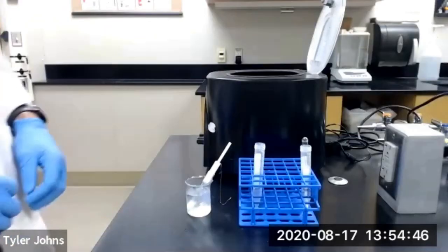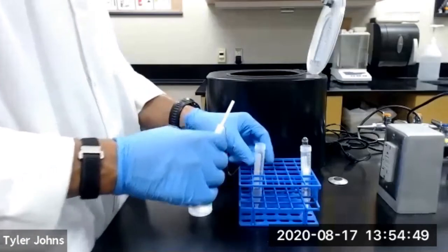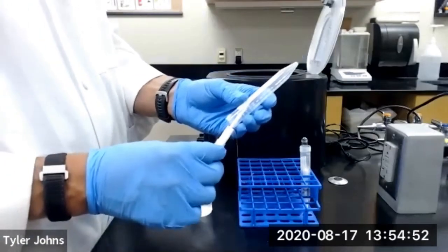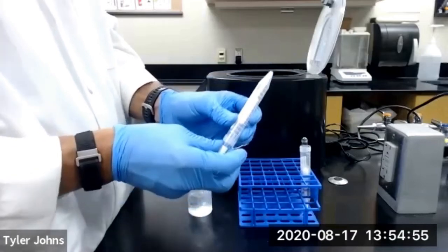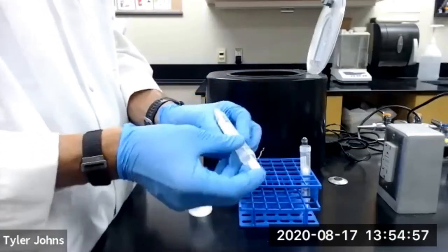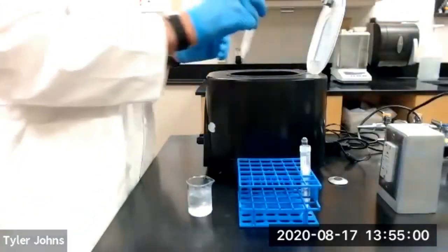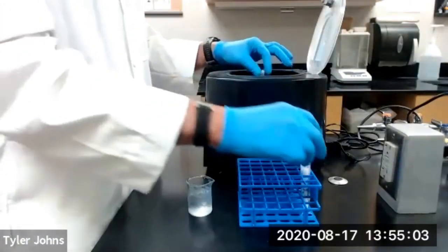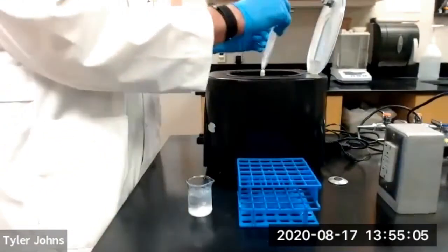Now that our crystallization is complete, we'll add our Craig tube to a centrifuge tube. Remember to insert the plunger first and have your copper wire attached. Then flip the entire assembly, and we'll add this to a centrifuge. Always be sure to balance the centrifuge.